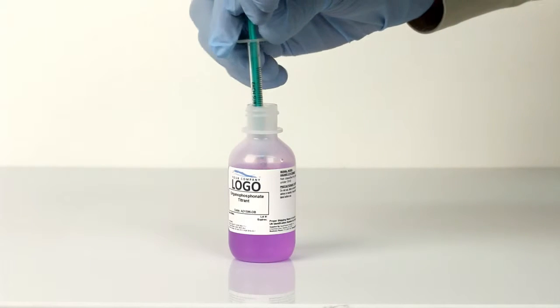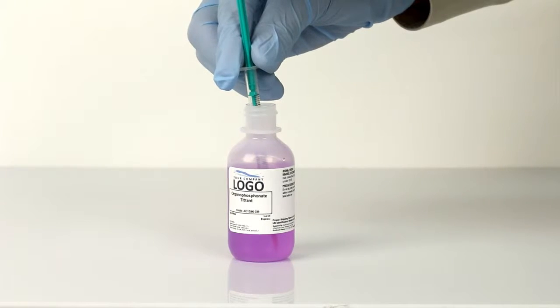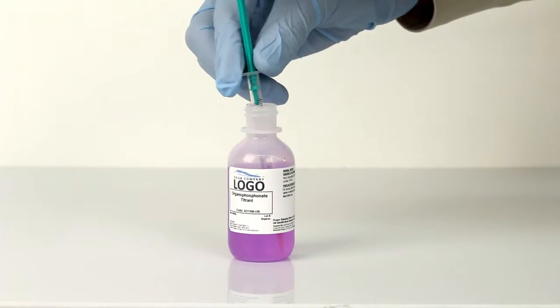Remove the cap from the titrant bottle and fill the syringe titrator to the zero line with OP titrant. Be careful there are no air bubbles trapped in the syringe.